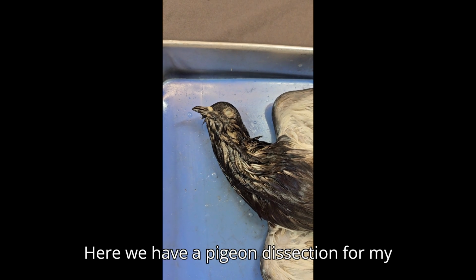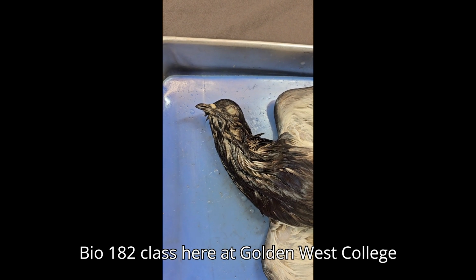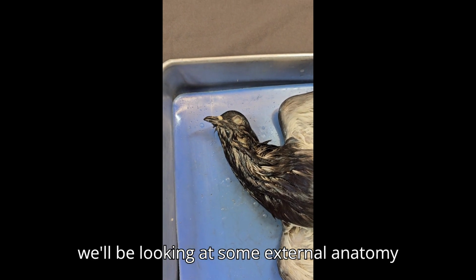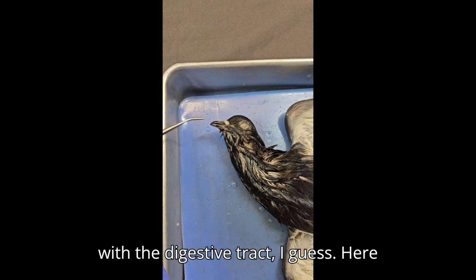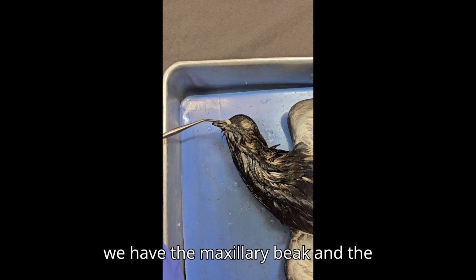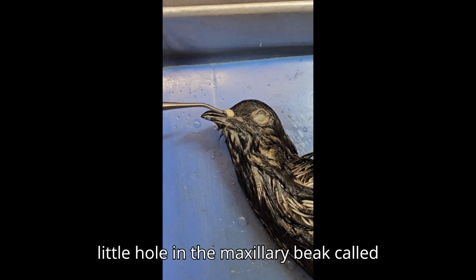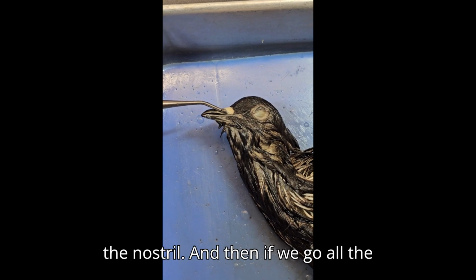Here we have a pigeon dissection for my Bio 182 class here at Golden West College in Huntington Beach, California. First, we'll be looking at some external anatomy with the digestive tract, I guess. Here we have the maxillary beak and the mandibular beak. And then there's a little hole in the maxillary beak called the nostril.